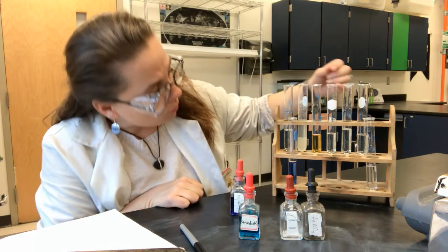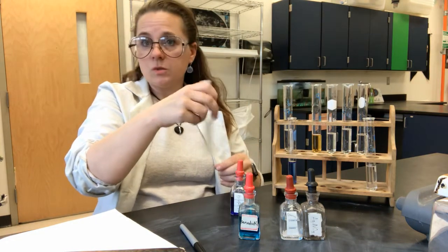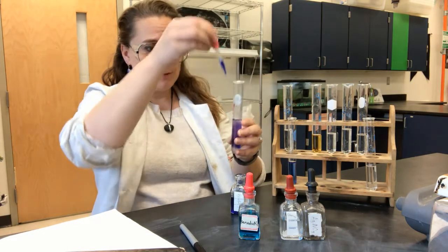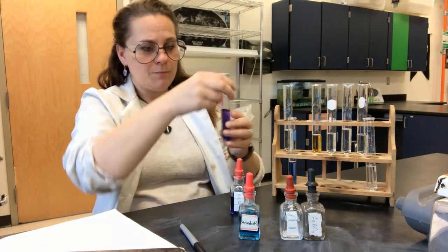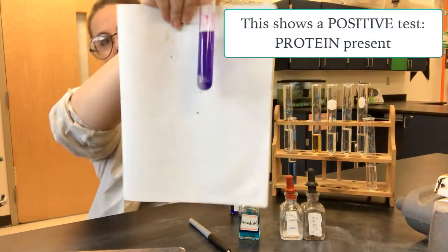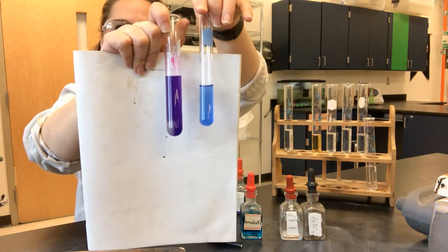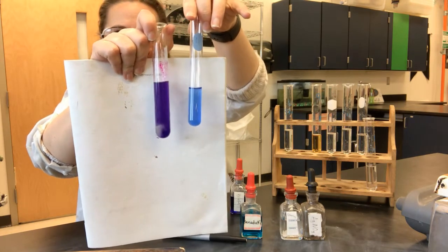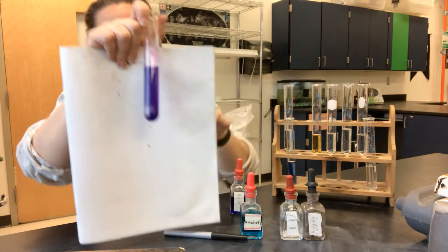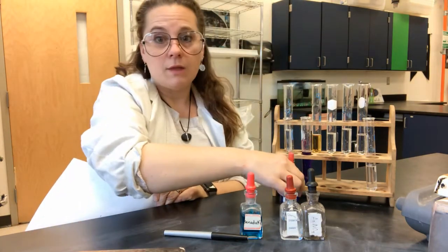However, if I do have protein present, Biuret is great because it's going to connect with the bonds that hold the amino acids together. I'll take my solution that has some protein in it, give a little swirl, and then add my drops. You can see I have a very purple color — comparing it to the blue from before, this very purple versus very blue means that protein is present in my solution. That's Biuret.